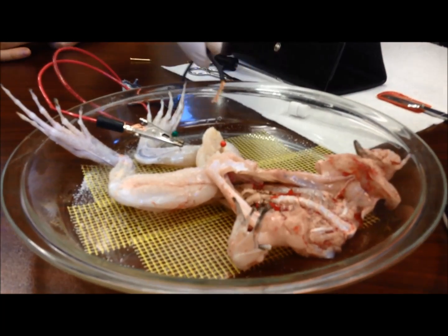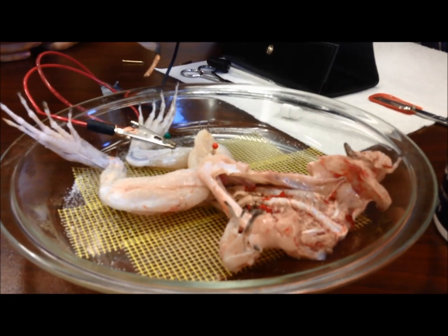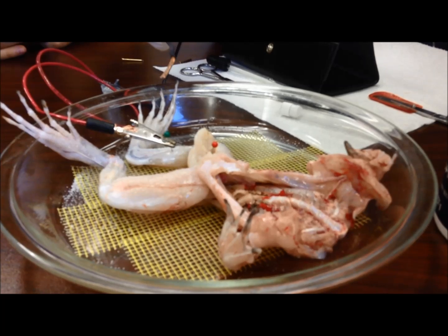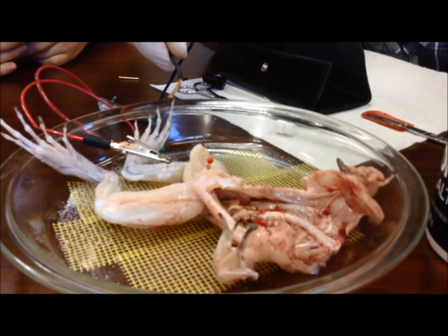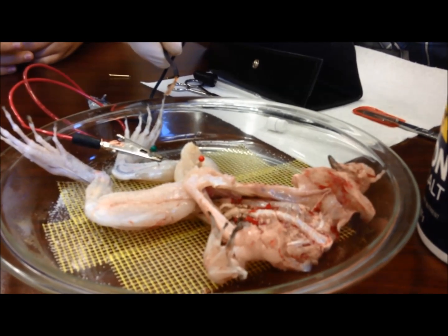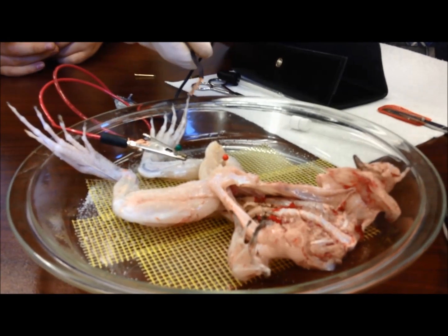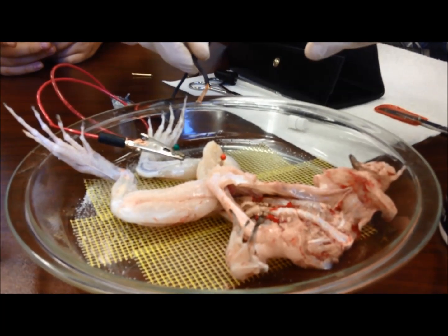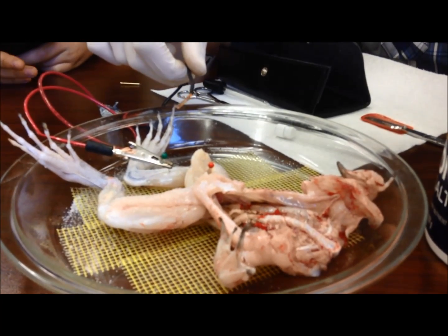Plus we're stimulating the nerve in this case. But muscles can be directly stimulated if we provide the right amount of ions. So when you stimulate the nerves, the nerves help release the neurotransmitters which travel down and activate channels that release calcium and other ions. But if you remove the nerve stimulation, there's no longer any nerve stimulation — so then if you add the same ions, muscles can still contract.